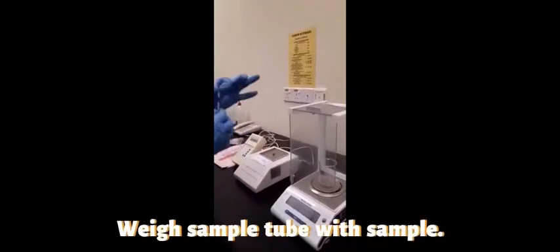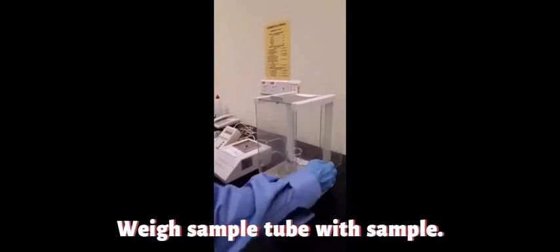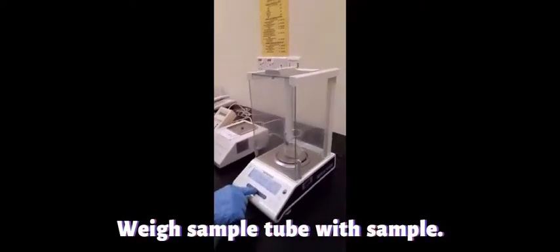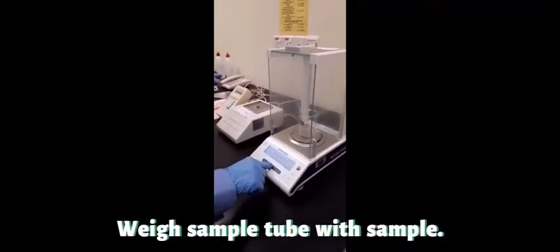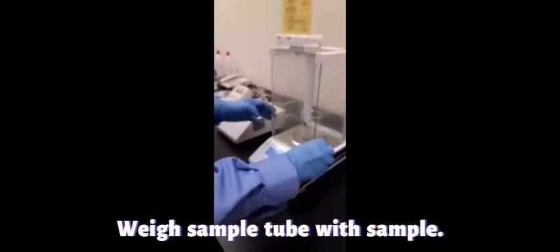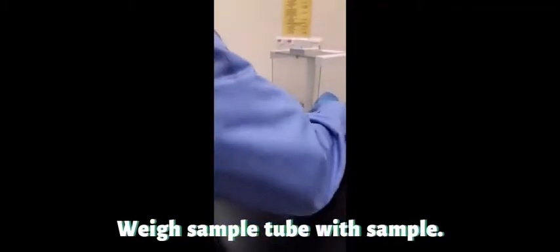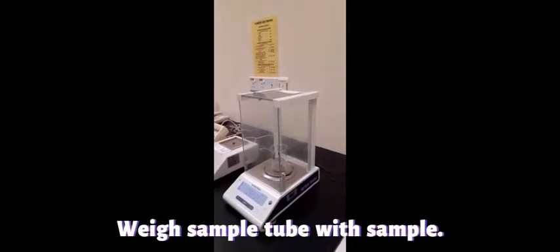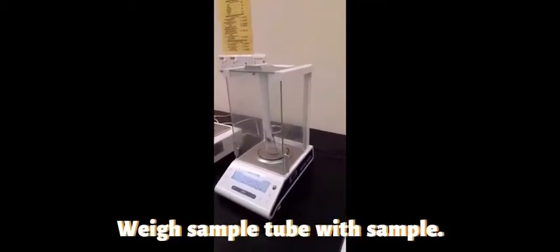Yes, 37 millimeter. We have to weigh the tube with the sample to get the weight of the sample. This is what we do. Tare, then weigh the sample and get the weight 0.99.